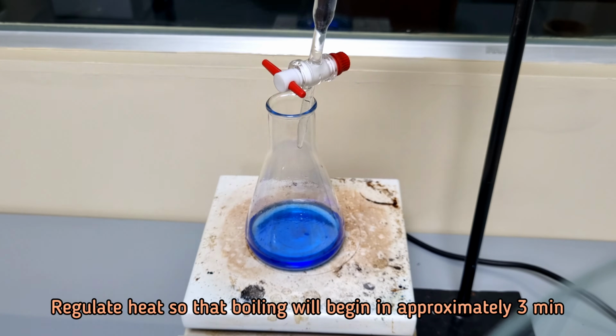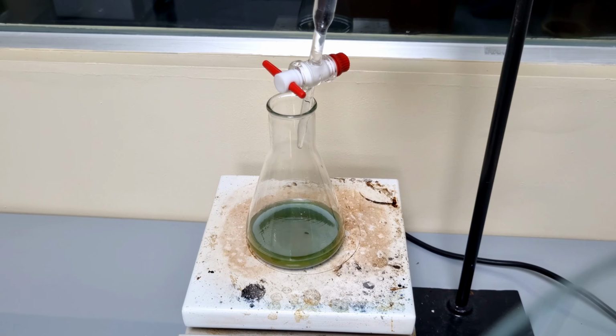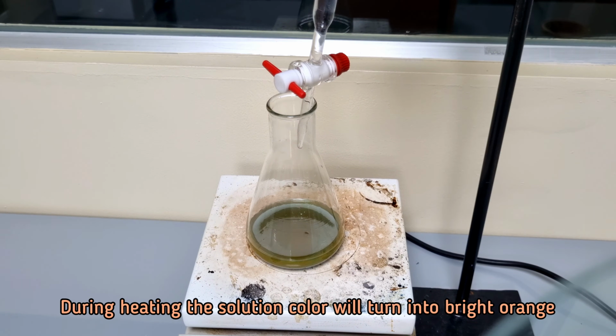Regulate heat so that boiling starts in approximately 3 minutes. During heating, the solution color will be changed slowly to bright orange.